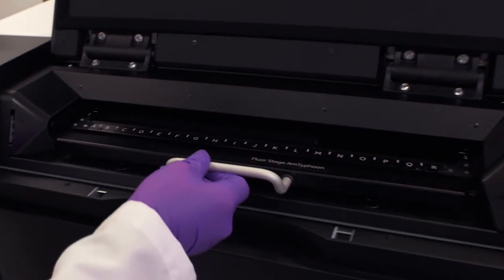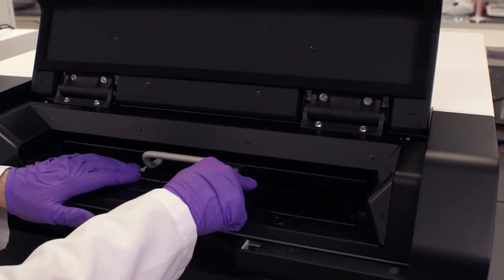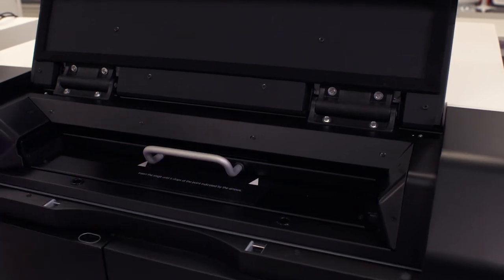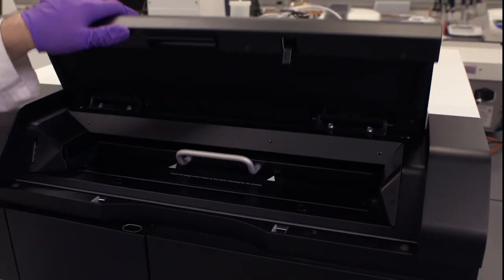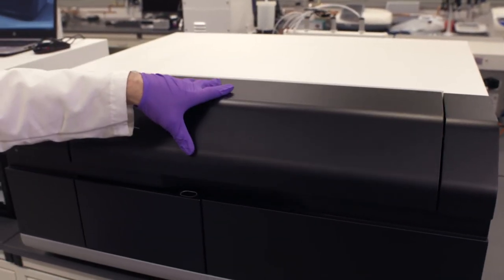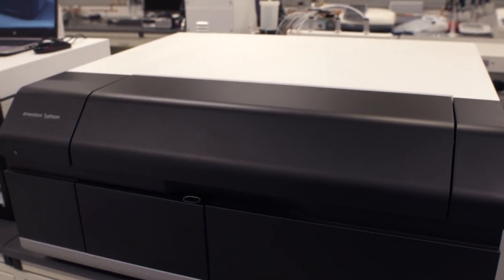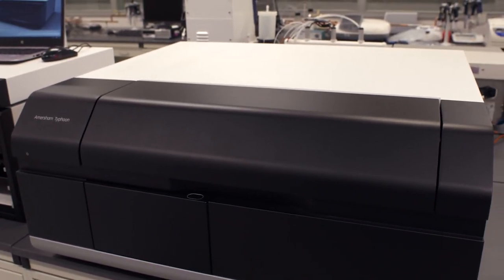We're going to close this, make sure we see the top of the apex of the triangles to make sure it's fully inserted in the machine. We'll then close the door and then we're going to get ready to set up with our control software for doing the Storage Phosphor Scan.